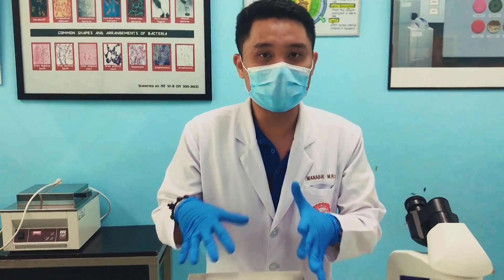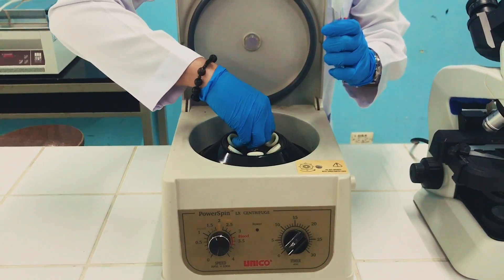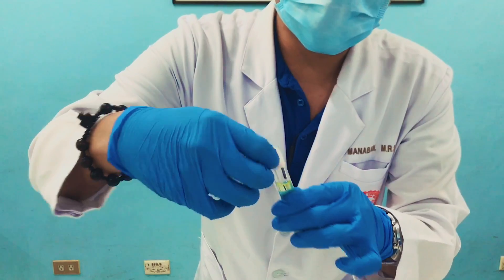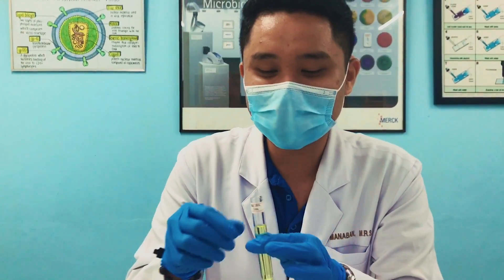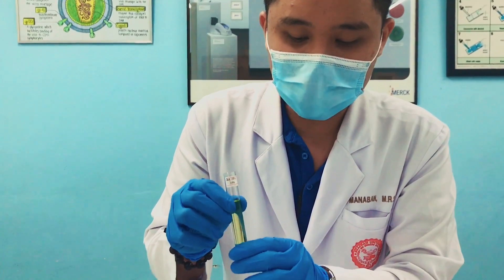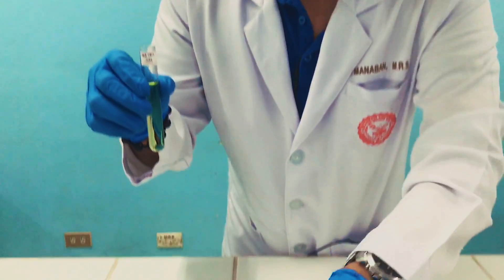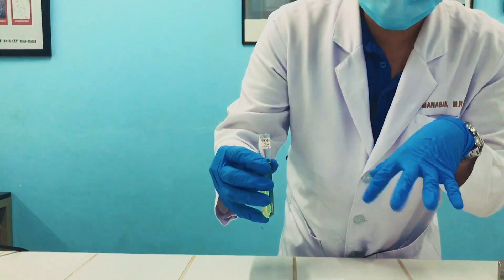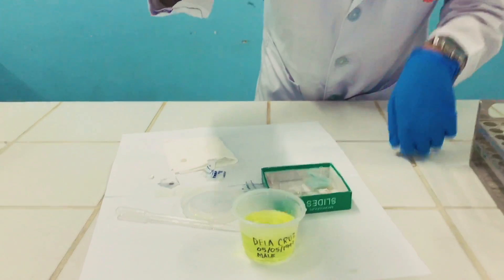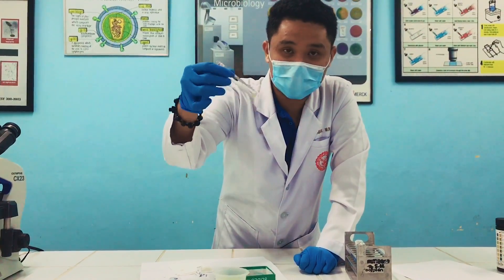After 5 minutes, the centrifuge has stopped and it's time to get our tubes. Open the centrifuge and get the tubes — your balancer and your specimen. Remove the parafilm covering the tube. The next procedure is what we call the bottoms-up technique. In urinalysis, bottoms-up is a procedure to decant the supernatant, leaving the sediment to be examined under the microscope. Open the container of your urine specimen and perform bottoms-up. The remaining volume should be about 0.5 ml, which is sufficient for microscopic examination.